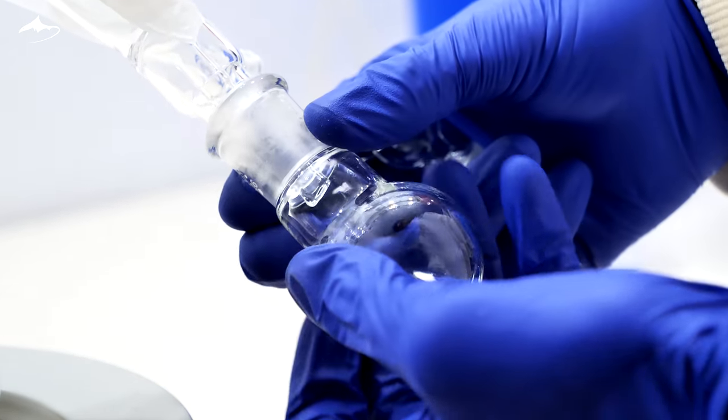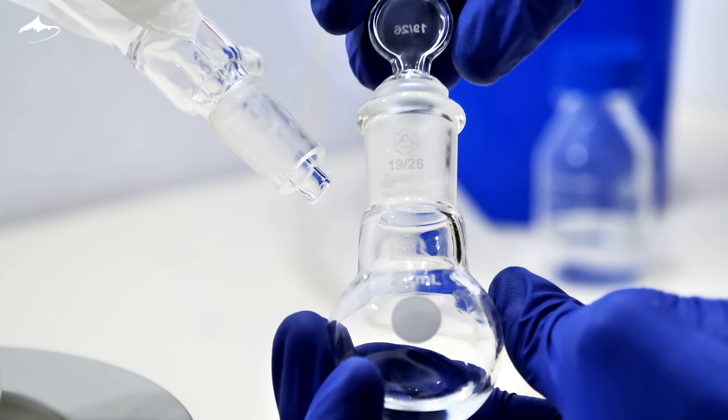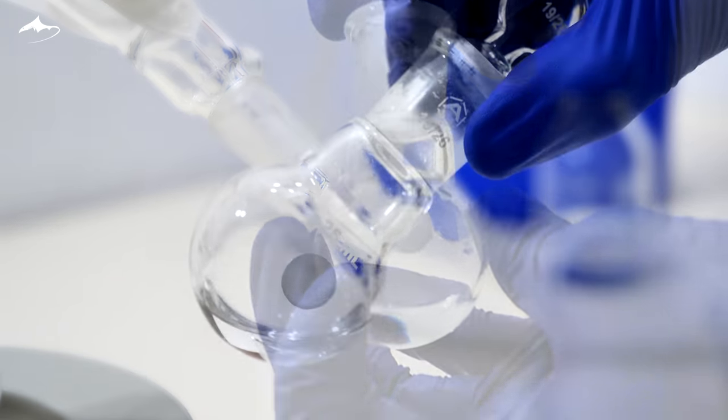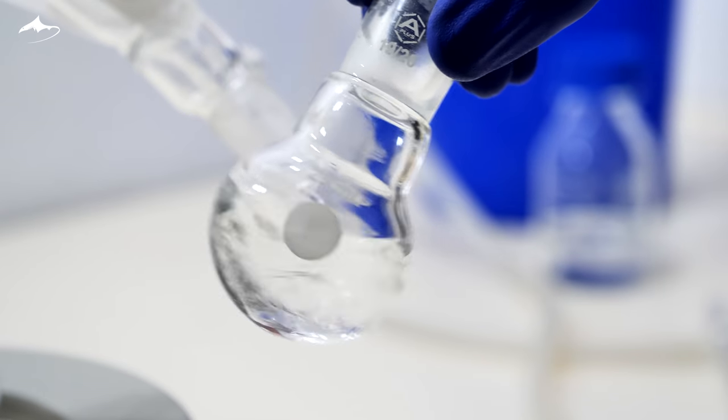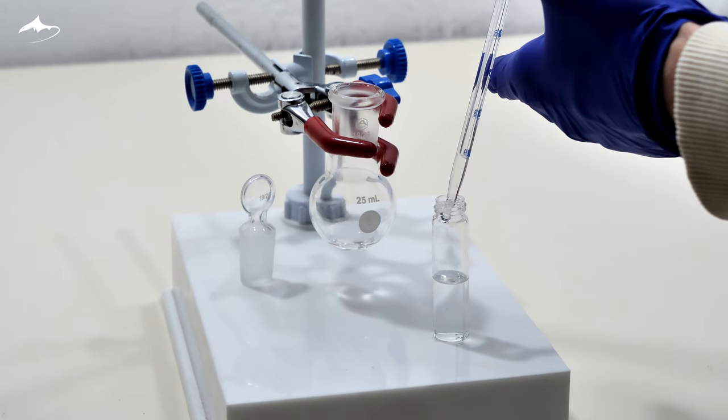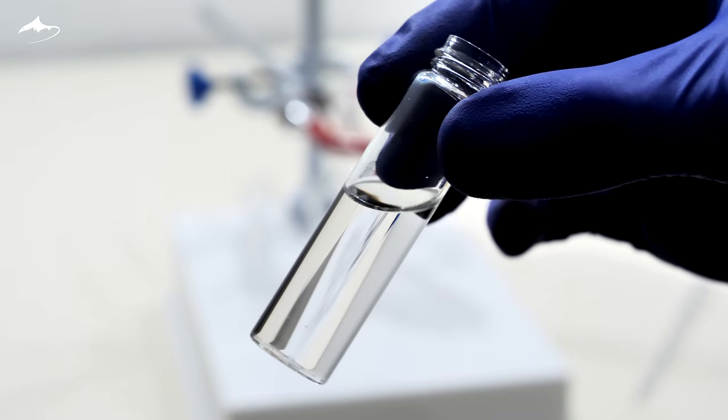Finally, here it is. A small volume of very rancid, cheesy and sharp smelling liquid. It is then transferred into a pre-weighed glass vial for storage.